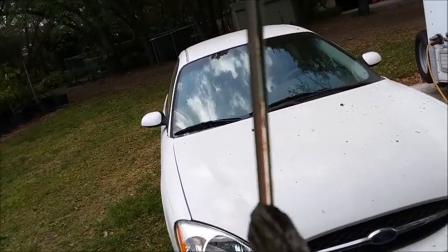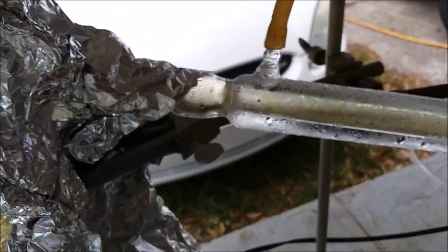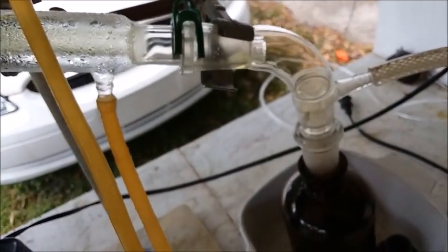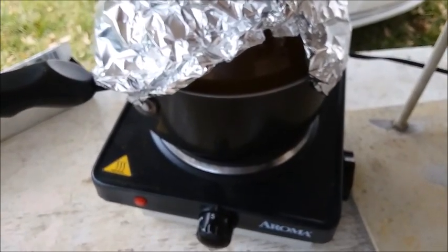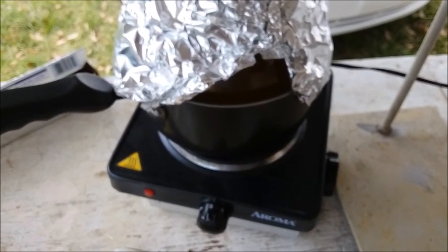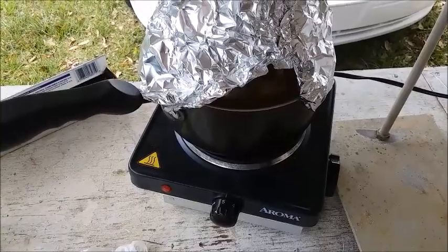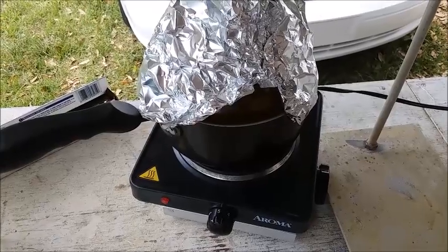Temperature is not quite up at the boiling point of pure nitric acid yet, but we're getting a lot coming over — it's really condensing in the condenser and coming down into the jar, so that's good. Still warming up with the second batch of reactants, and I'll do at least one more batch after this. I think I'll stop after three because the boiling flask starts getting full of stuff and I'm a little worried a boil-over could happen. But still, three batches is going to give me a lot of nitric acid, cheaper than I can buy it.